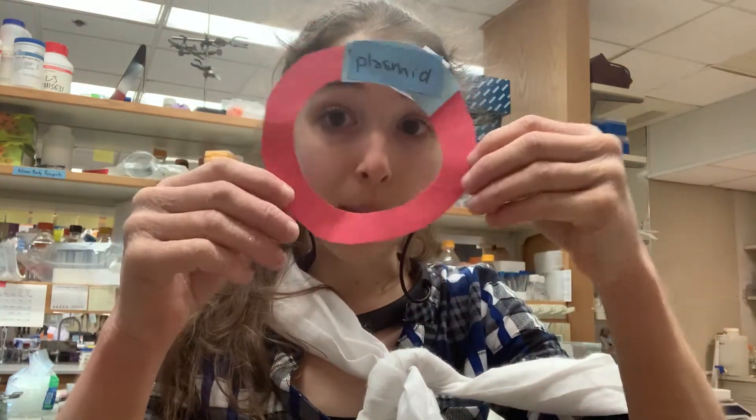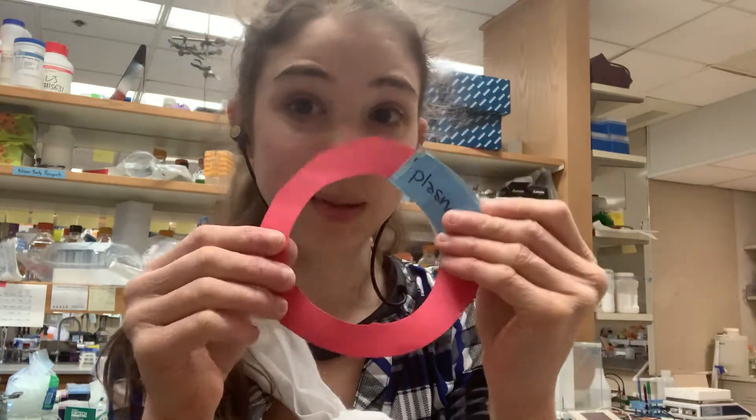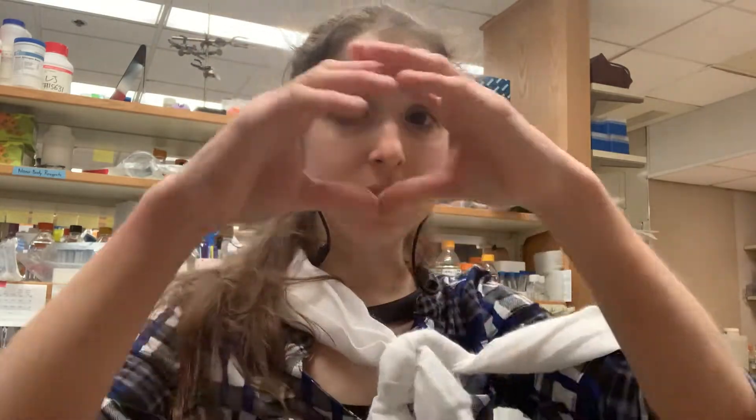But what if your DNA isn't linear? What if you have a plasmid, which is a circular piece of DNA into which we can insert instructions for making a protein into a vector backbone to form a plasmid, then stick it in bacteria and they'll make a lot of copies. It's kind of like a snake biting its tail — now it's a circle and it's going to travel differently through the mesh. You might expect it to travel slower, but sometimes it actually travels faster than if it were linear.